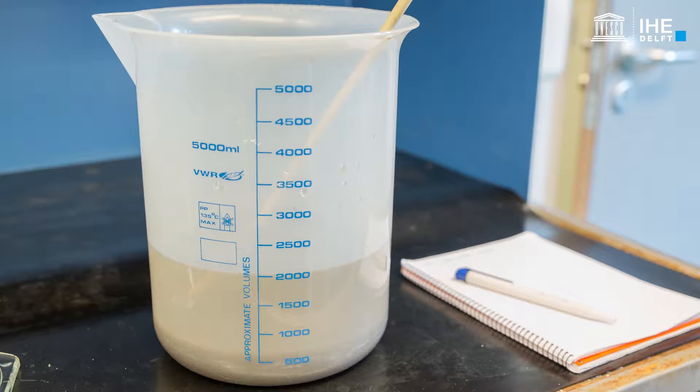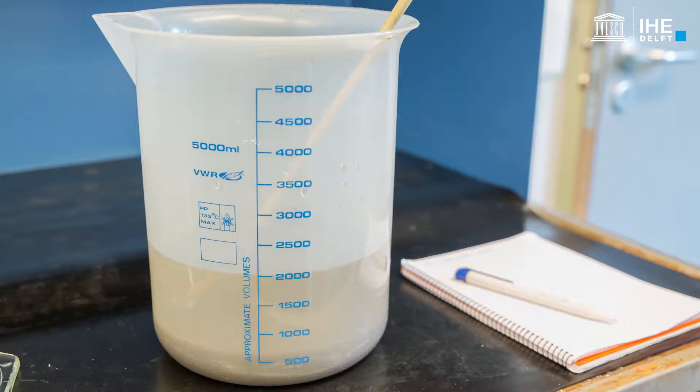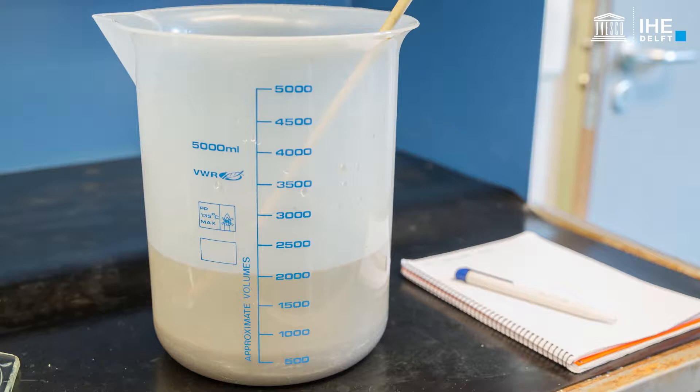Necessary equipment: a 1 litre graduated cylinder, a sludge sample, and a timer. The activated sludge sample should be collected from the feed flow into the SST.